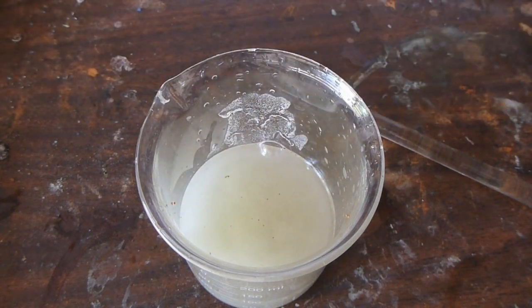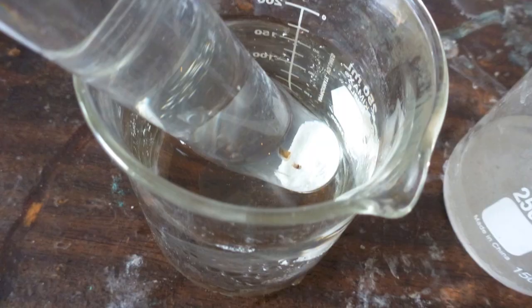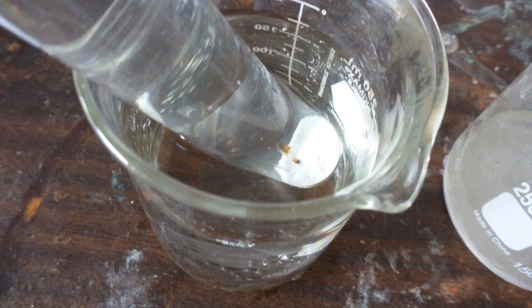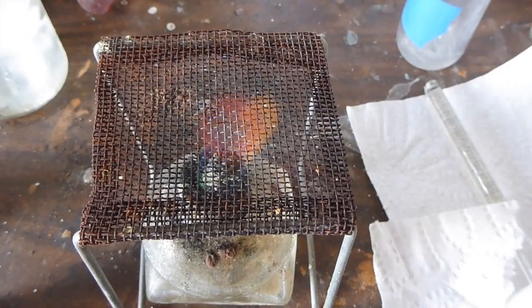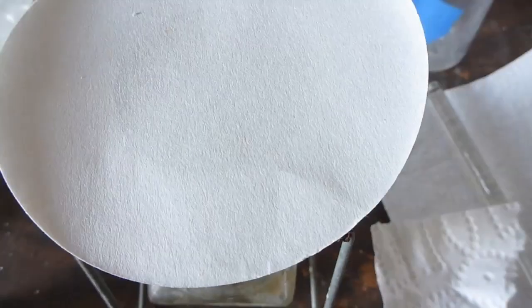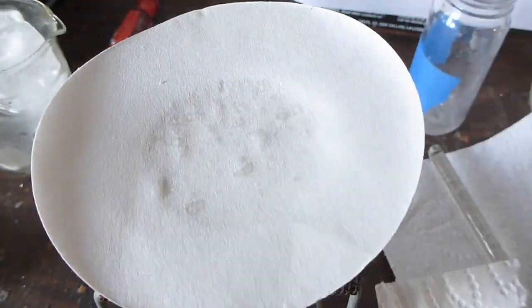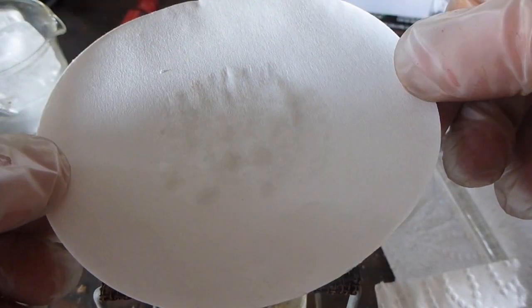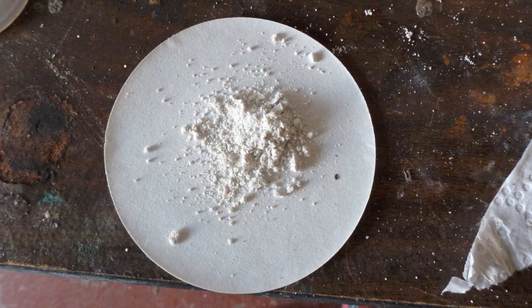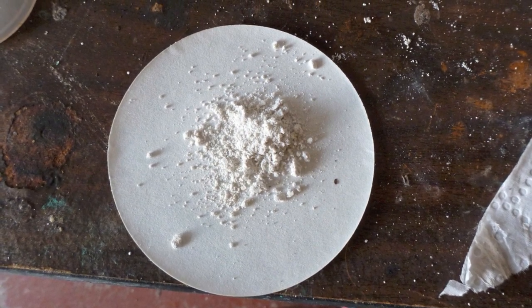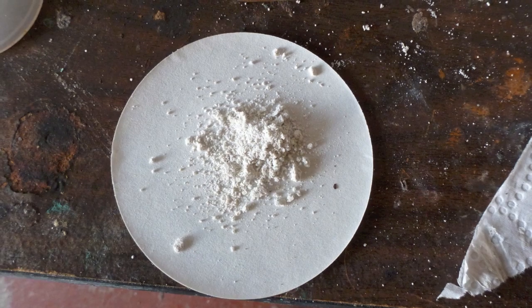So here I am cooling it down in cold water. And then I found that it's actually pretty stable to heating, so I just heated it directly in a crucible to dry it out. And I'm left with this really nice powder of potassium periodate.